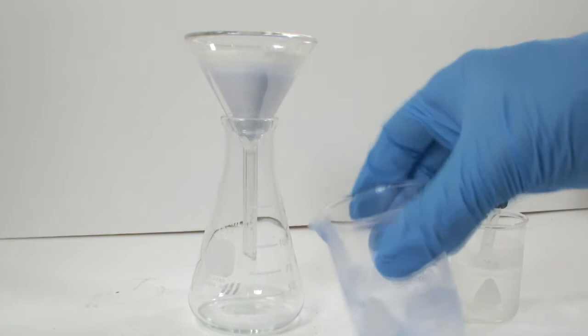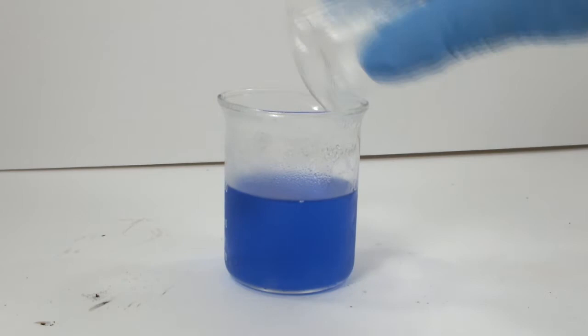In addition, it would be completely disastrous to rinse out the beaker with water. I'm using more ice cold acetone for that as well. Next up, I'm going to precipitate out the chloride.